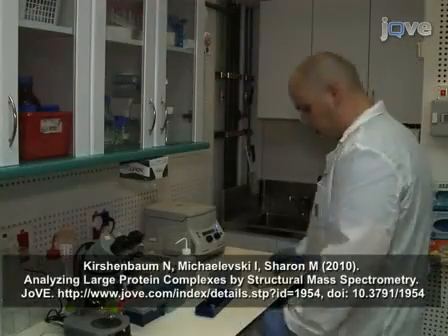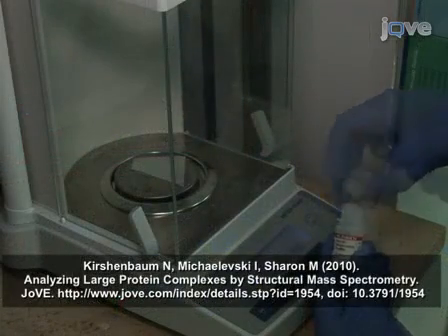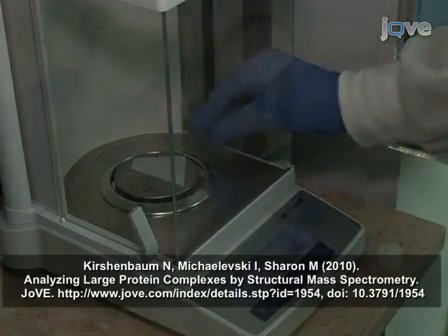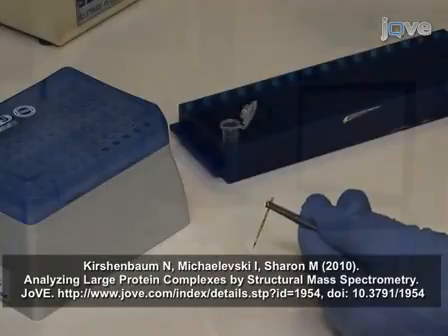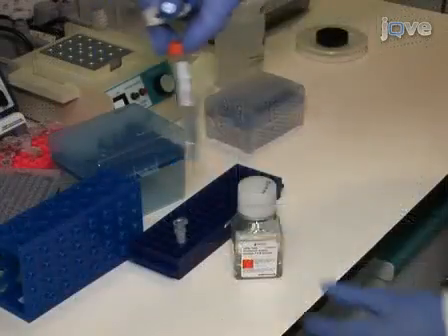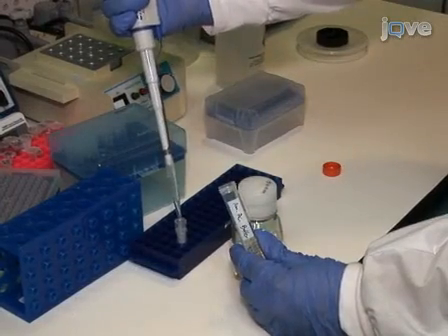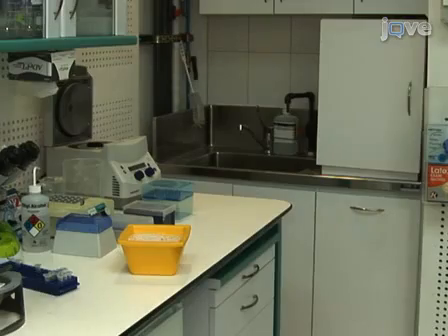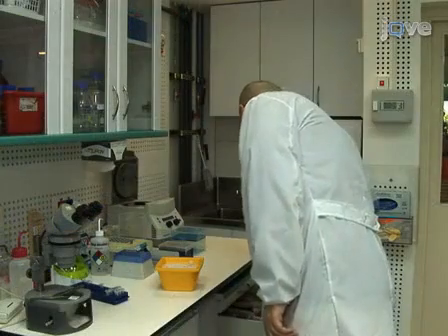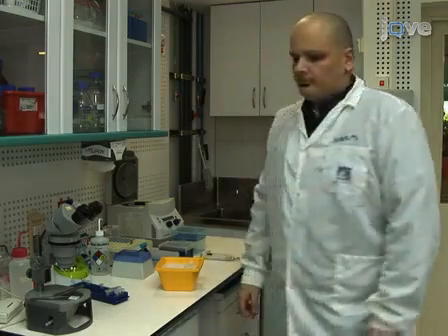This procedure focuses on ion mobility-mass spectrometry or IMMS analysis of protein complexes. The sample preparation steps, instrument calibration, and MS and tandem MS optimization procedures are demonstrated in a related Jove protocol. In general, this protocol involves low micromolar concentrations of complex in a volatile buffer such as ammonium acetate. Given that 1 to 2 microliters are consumed per nanoflow capillary, prepare 10 to 20 microliters as a minimum volume to enable optimization of MS conditions.